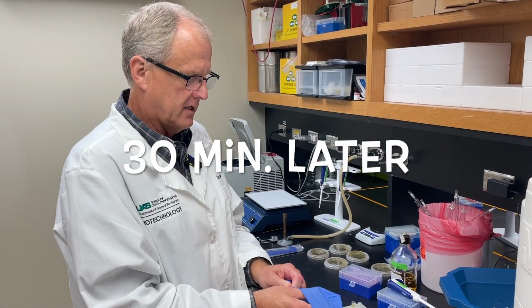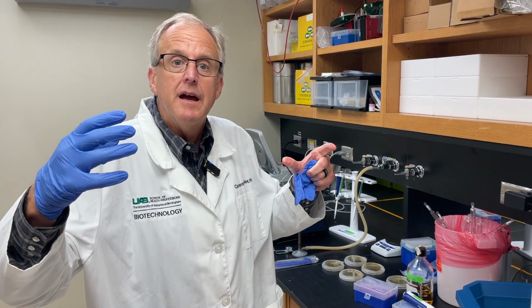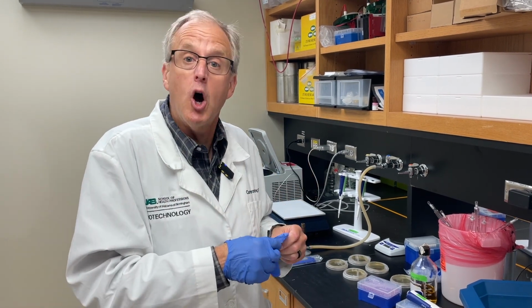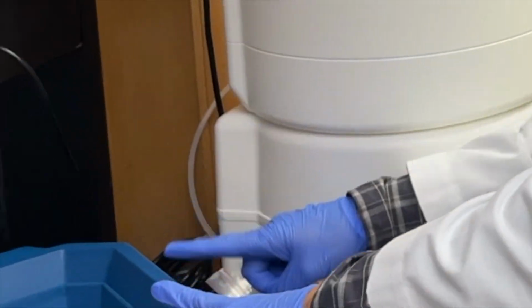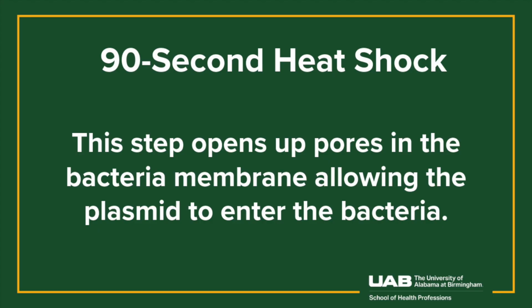We have let the plasmid and bacteria incubate on ice for 30 minutes. That allows the plasmid to come in contact with the competent bacteria. Meanwhile, we have to set our water bath to 42 degrees Celsius, and you'll definitely have to have an ice bucket. Our control, no plasmid. Plasmid. Let's go ahead and heat shock for 90 seconds at 42 degrees.